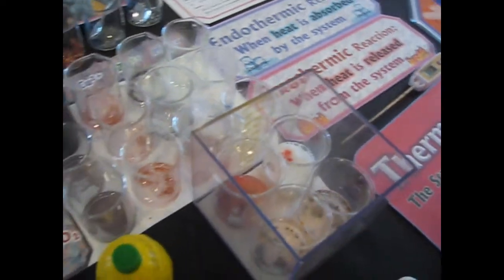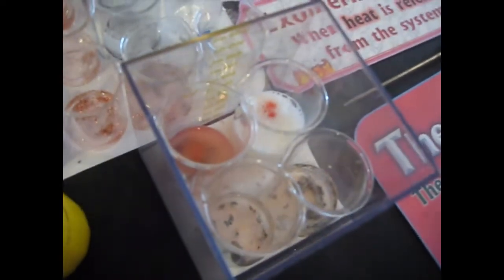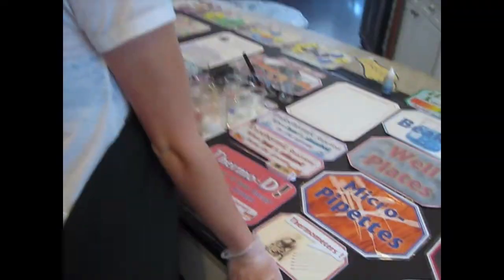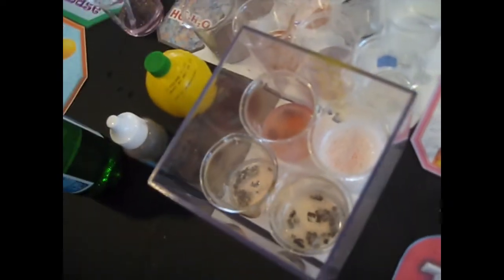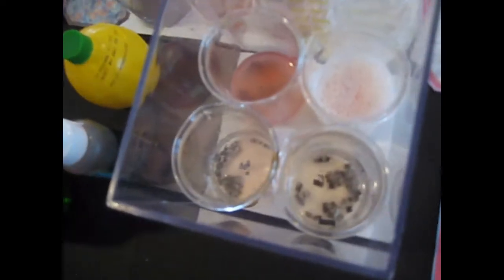Okay. That one's just frothing up, so you can't really tell. That one I can't really tell because it's just the foam. But isn't some kind of reaction going on? Well, see the red? That shows that right there, that spot is an acid. One thing we could do is stir it around with that end of the spoon and see if it turns red. So is lemon juice an acid? Yeah. And is Pellegrino an acid? Is it reacting? Yes.